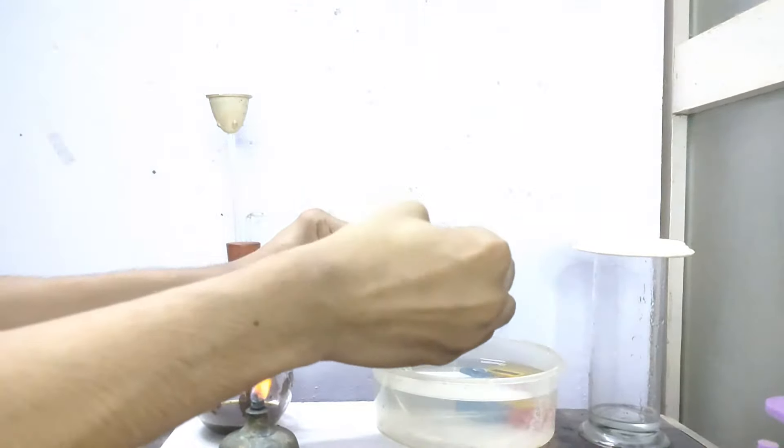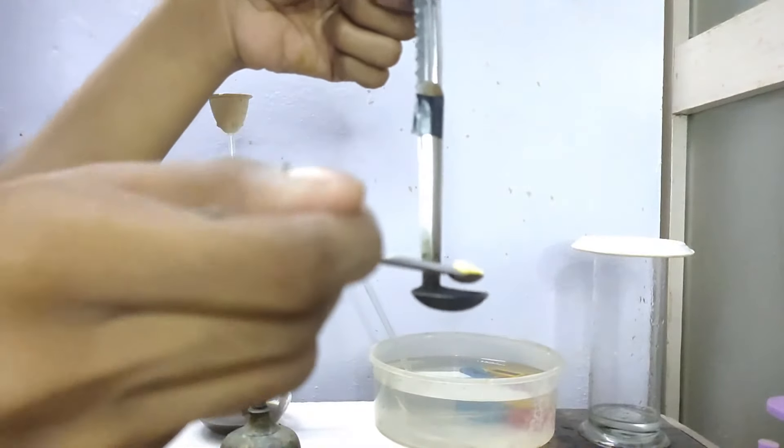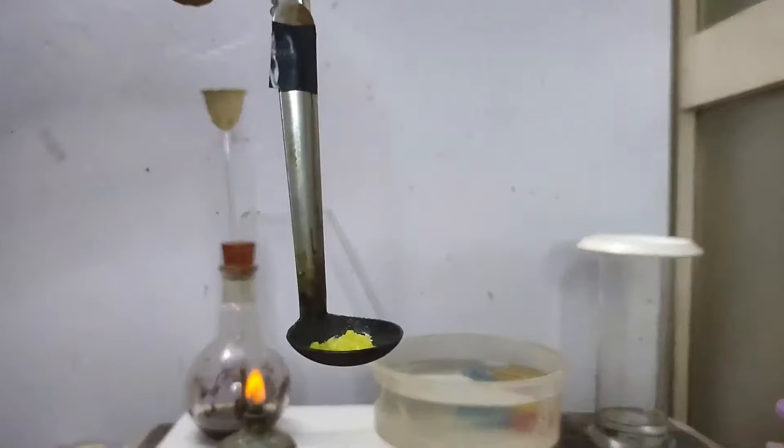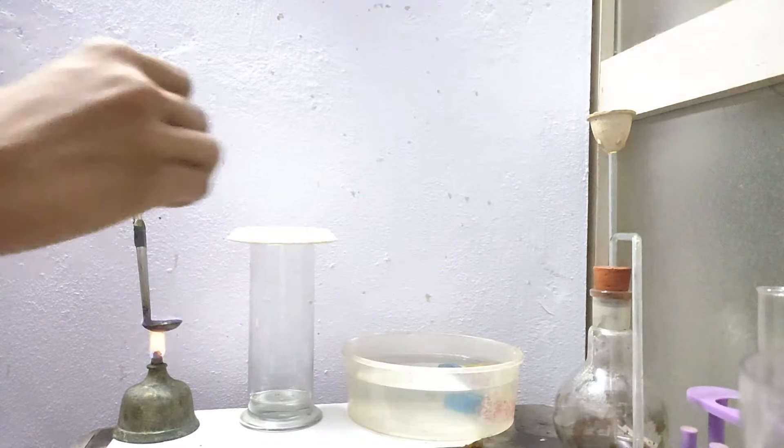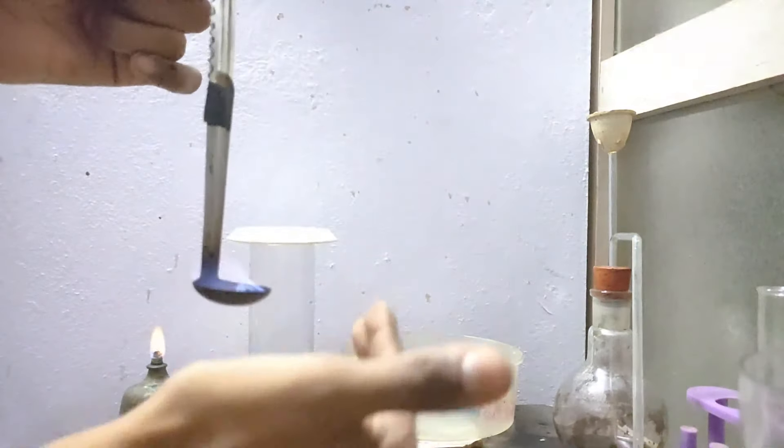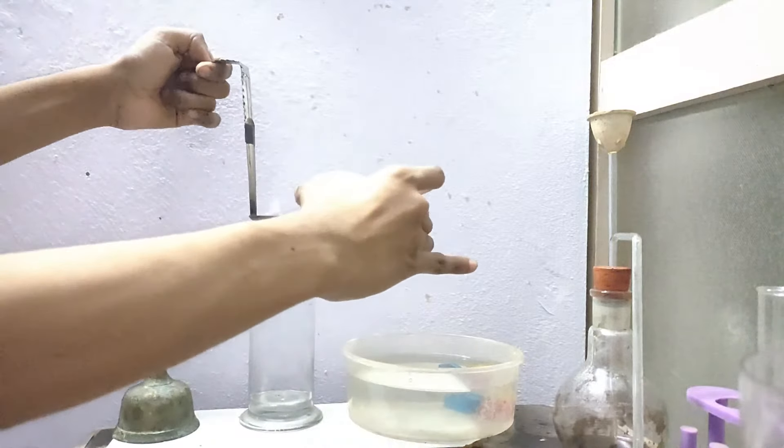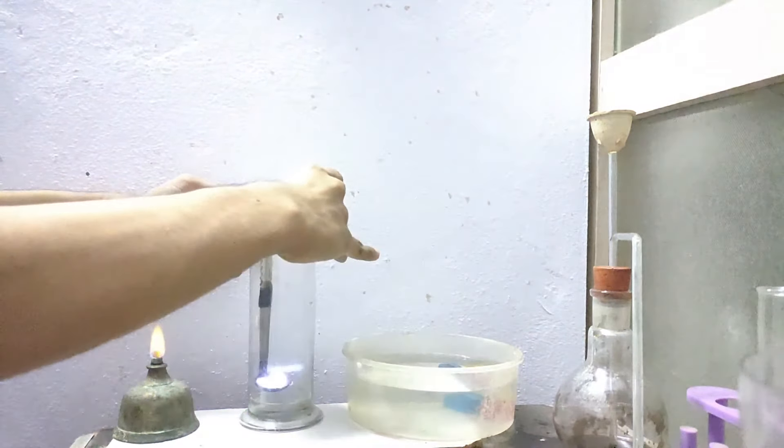Now for another demonstration, I am taking some sulphur in a deflagrating spoon. And when it starts burning, I will insert it into a gas jar which is filled with oxygen gas.